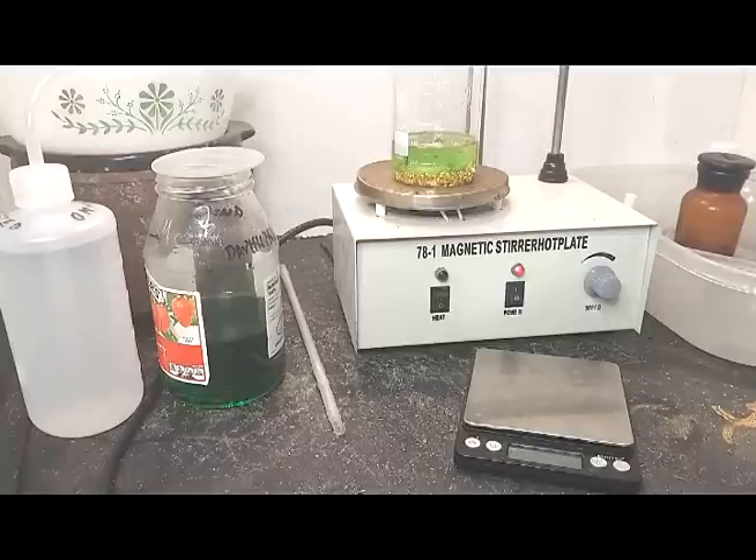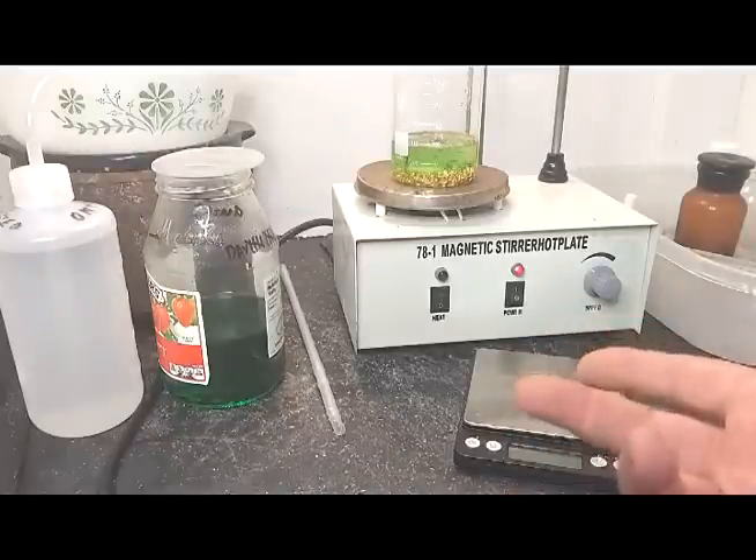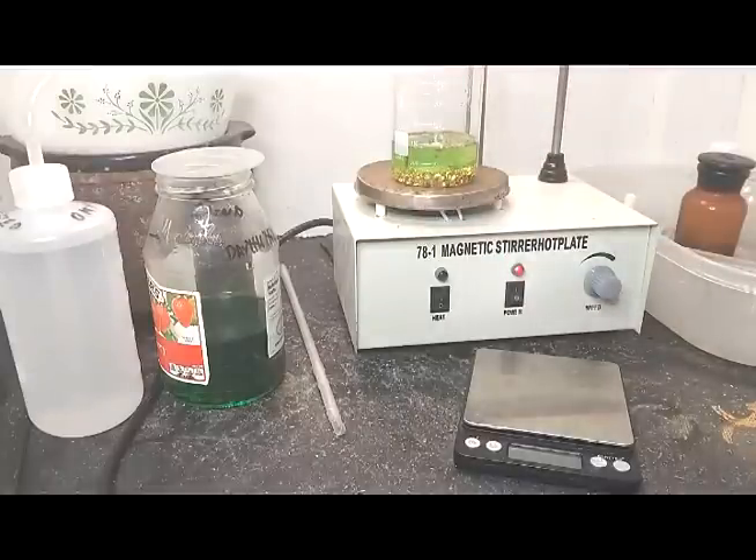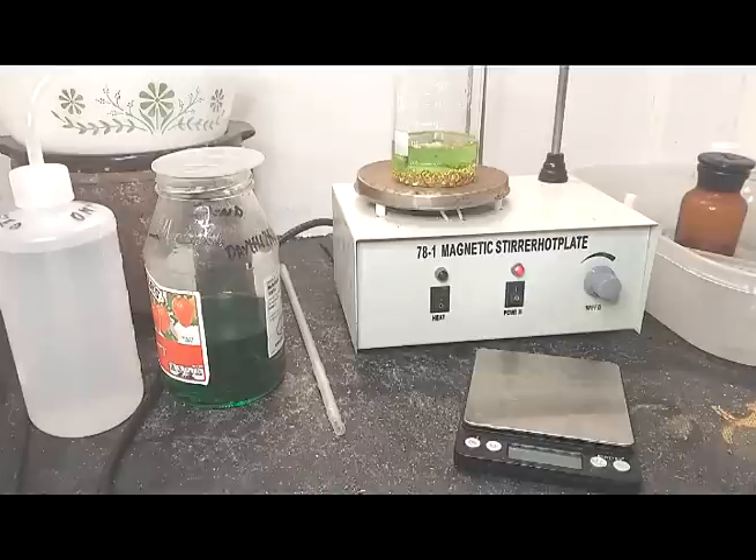Can we recover the little, minute amount of gold? What did we say — 37, 38 grams? It wasn't much. Can we recover it using copper chloride in solution, and of course no nitric acid whatsoever? Periodically we will add some 3% hydrogen peroxide to oxidize it and change its chemical state somewhat. And that's it — we'll be back.